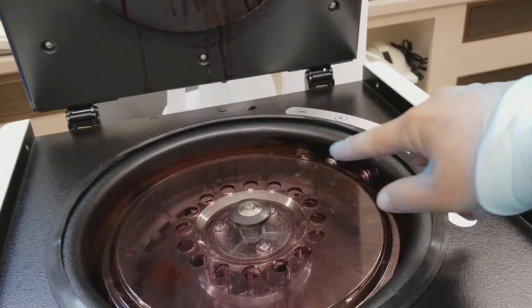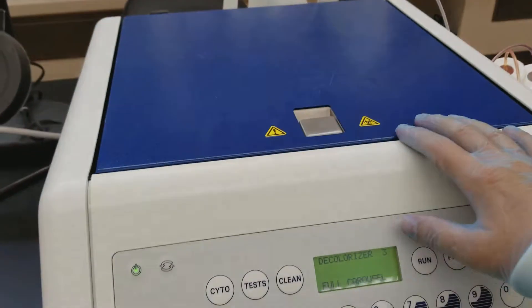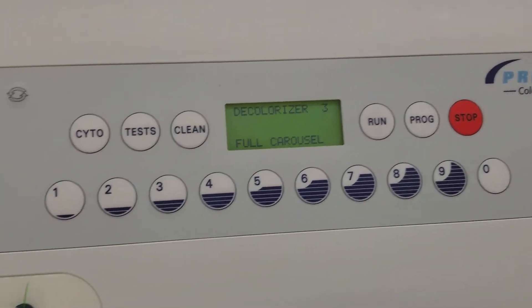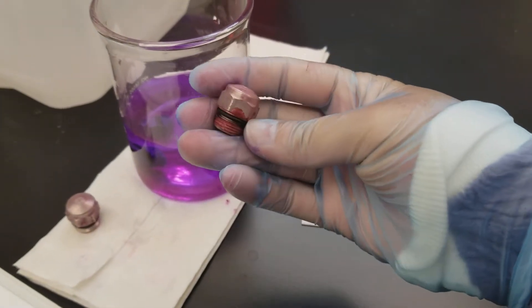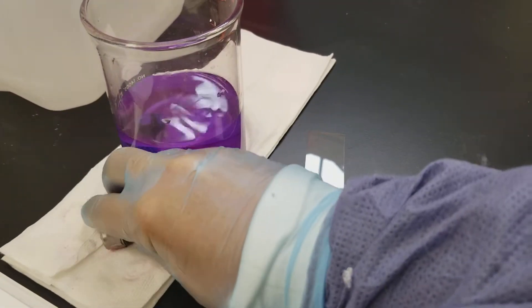It was sprayed through so that we won't get any issues with deposition or crusting over of any of the nozzles. I had put these in the solution in order to clean them and make sure they were usable, because I had clogs before.